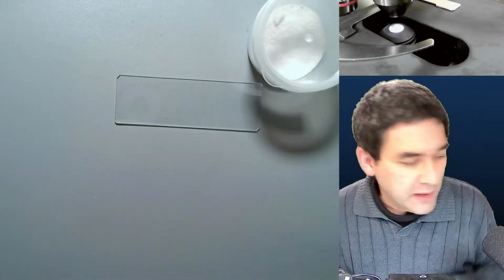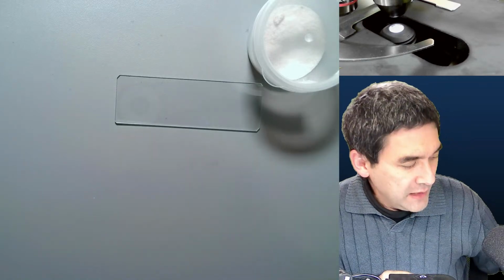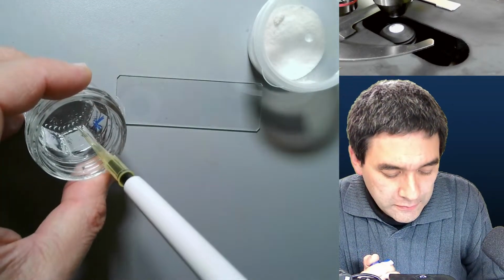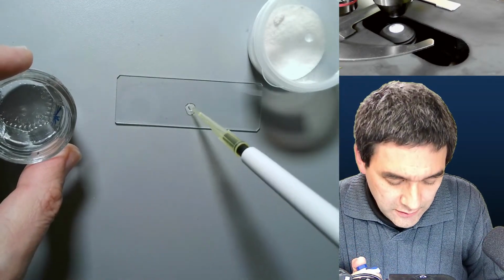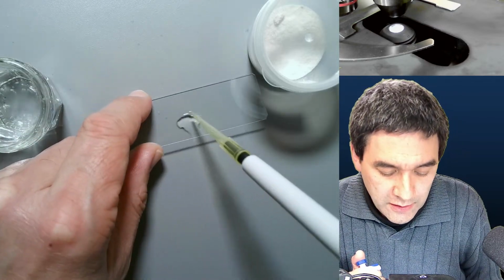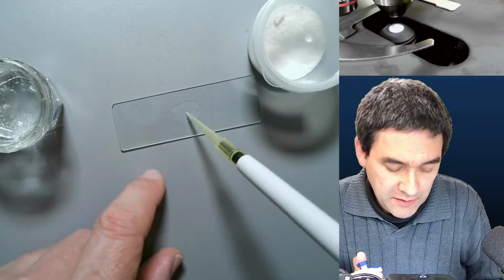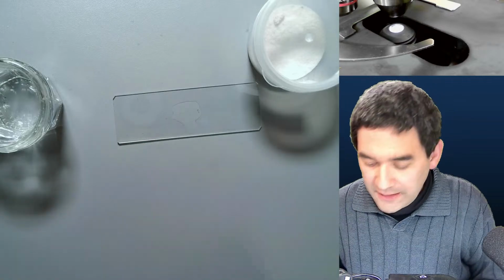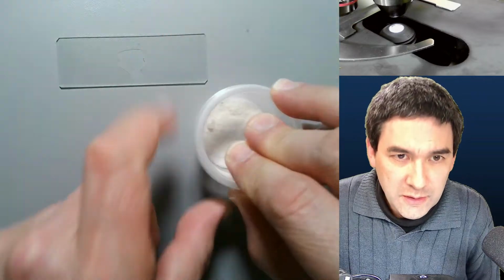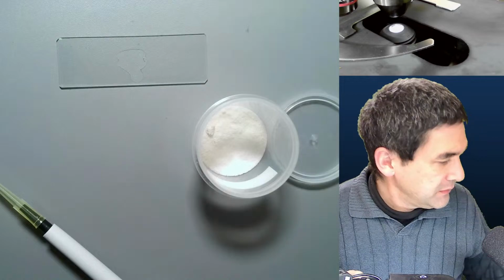And what I'm going to do now is take a pipette. Here it is. And I'm going to add a small amount of this water with a little bit of soap on here. You probably have already seen me do this before, and you can see that because of the soap in here, the drop spreads more easily. That's actually good. And then I will add a small amount or a larger amount of this citric acid. Let me quickly rinse this here.